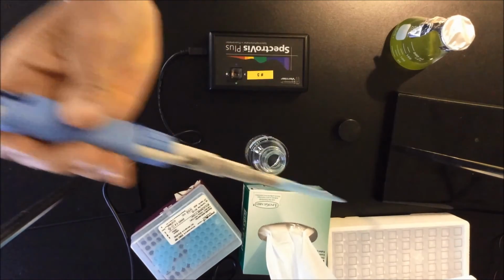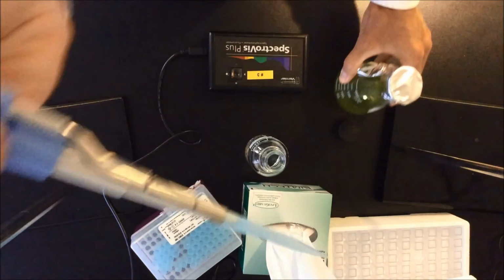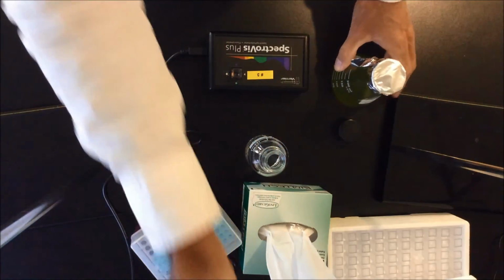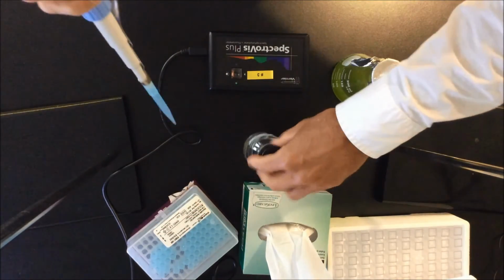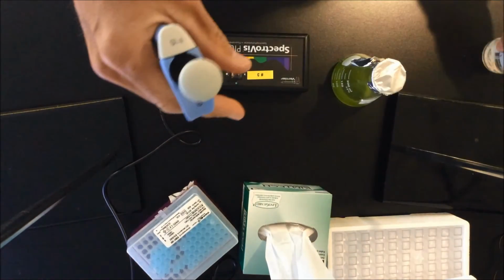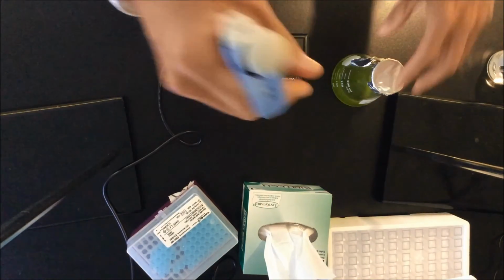When the device has been calibrated, the tip that you've used for the growing medium needs to be discarded. You cannot use the same one to measure the algae. If there's a tiny drop, you're going to dilute this and the measurement would be incorrect. So you need to discard the tip and take a brand new one. I know it's a lot of waste, but if we want accurate measurements, that's the way to do it. You take the cuvette with the growing medium and discard it. There should be a tiny beaker where you can put all your waste, and then you start all over again.